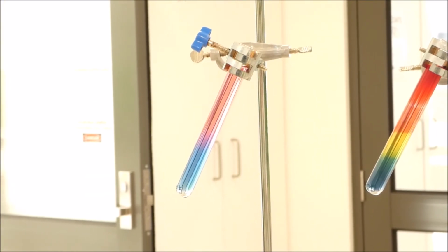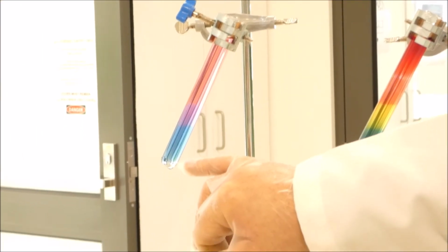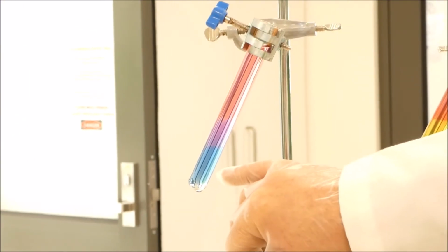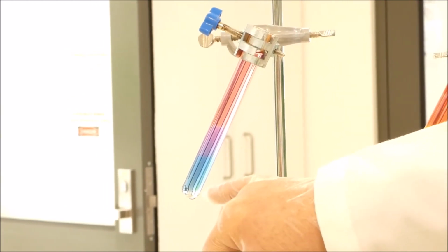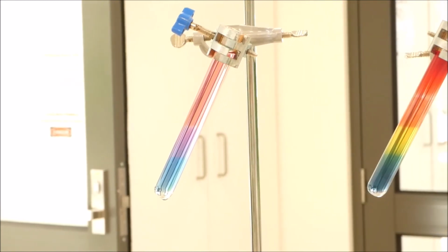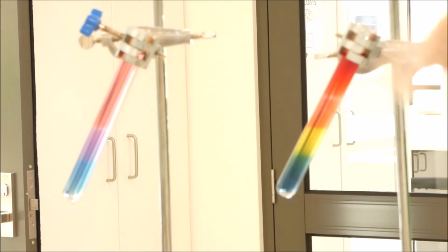Now, with the red cabbage indicator, there weren't as many different colours involved with the colour change, but you can actually see quite clearly three colours. The anthocyanin, which is the chemical that's in the indicator, goes from blue to a violet colour in the middle to a pink colour at the top. Blue at the bottom where it is still basic with the sodium carbonate, then it's purple where it becomes neutral where the acid mixes with the sodium carbonate, and then it's finally red where the acid still is unchanged.